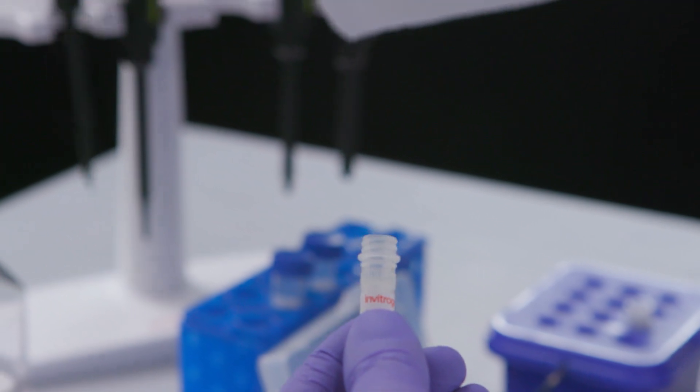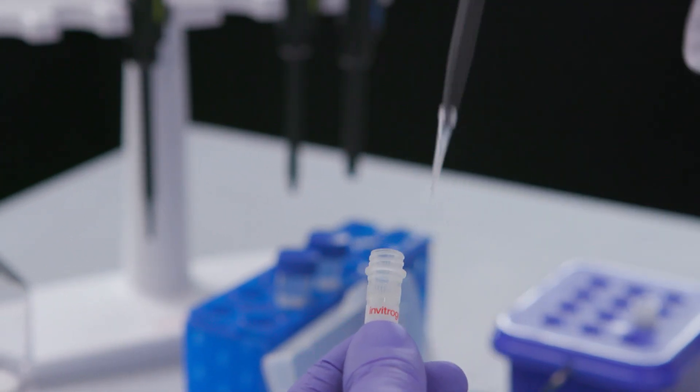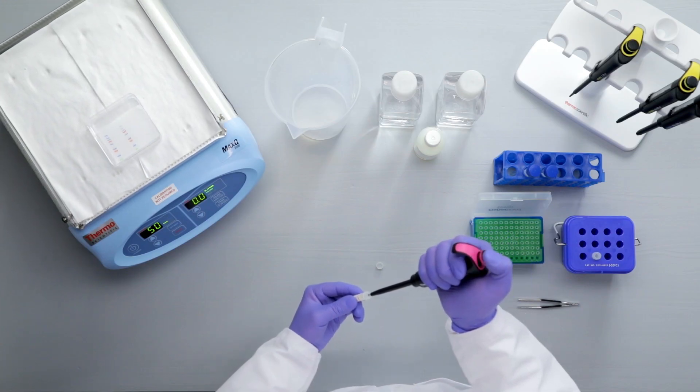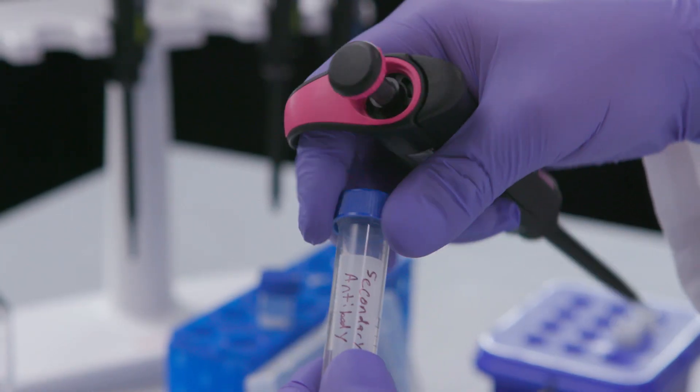Next, dilute the secondary antibody in wash buffer or blocking buffer. The final concentration of the secondary antibody will depend on the detection system used.